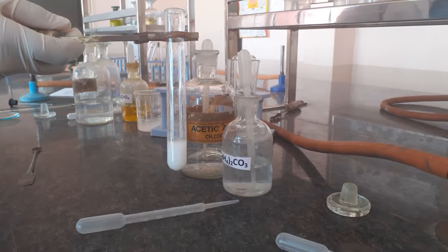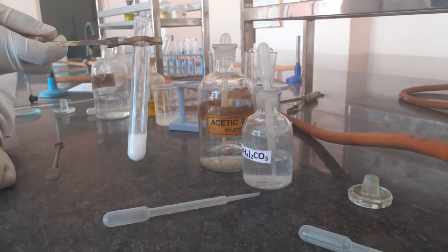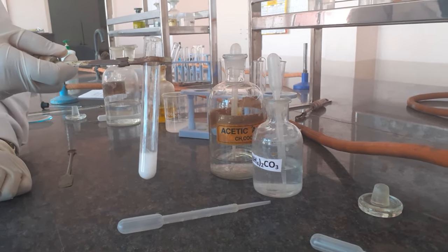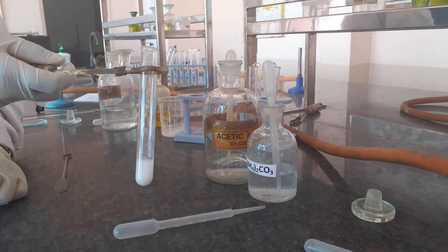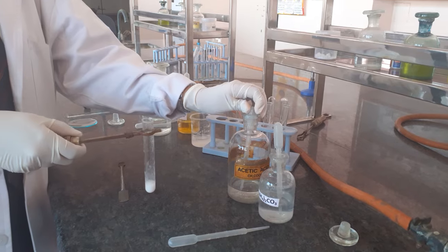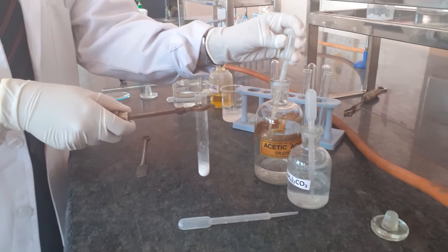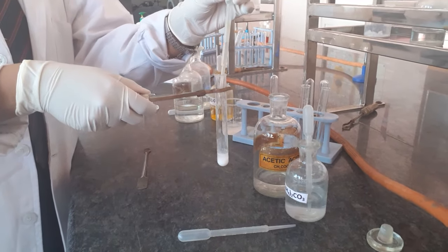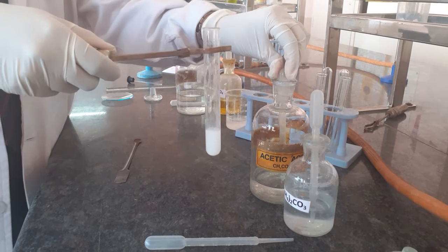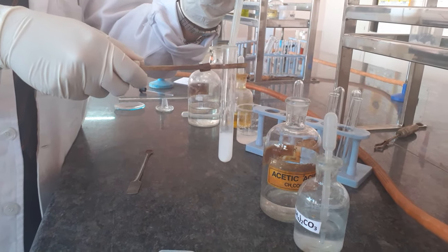To proceed further, dissolve the white precipitate in acetic acid. If you have a large amount of PPT, take half of it and dissolve in acetic acid to avoid requiring excessive acid. Keep stirring and adding acetic acid until the solution becomes absolutely clear.